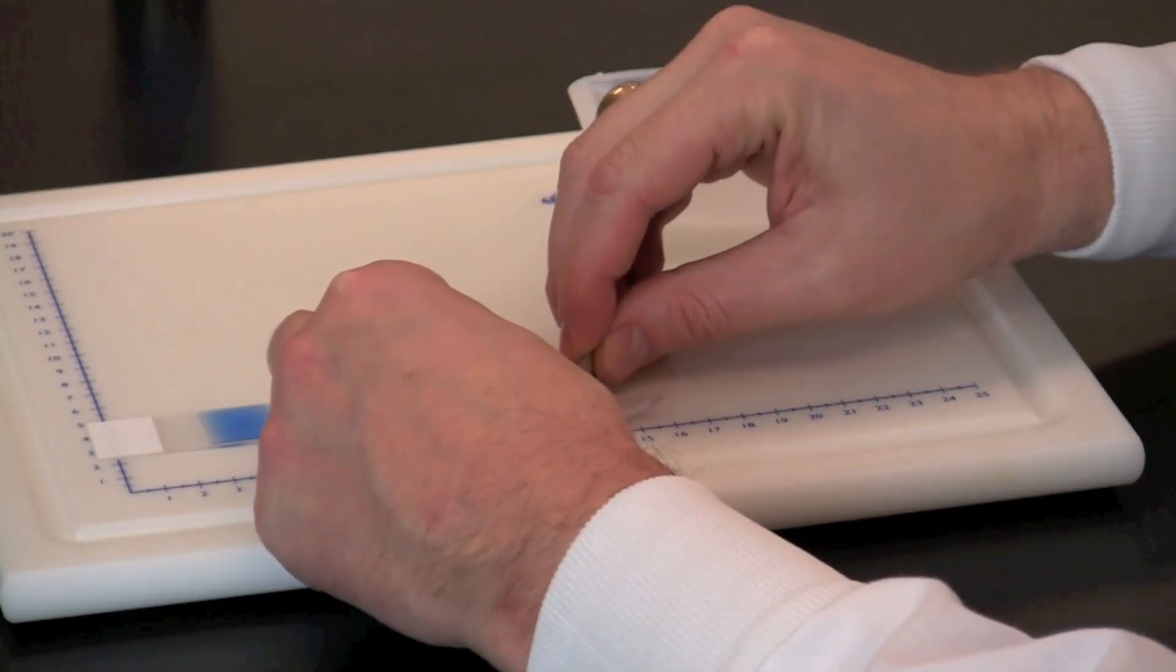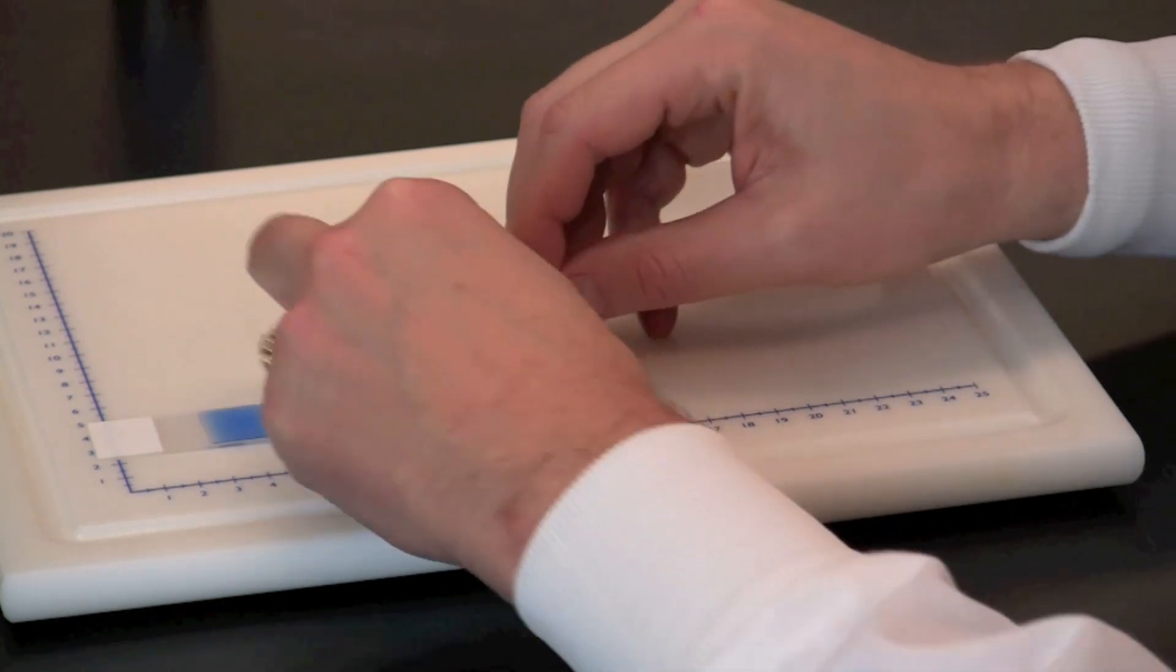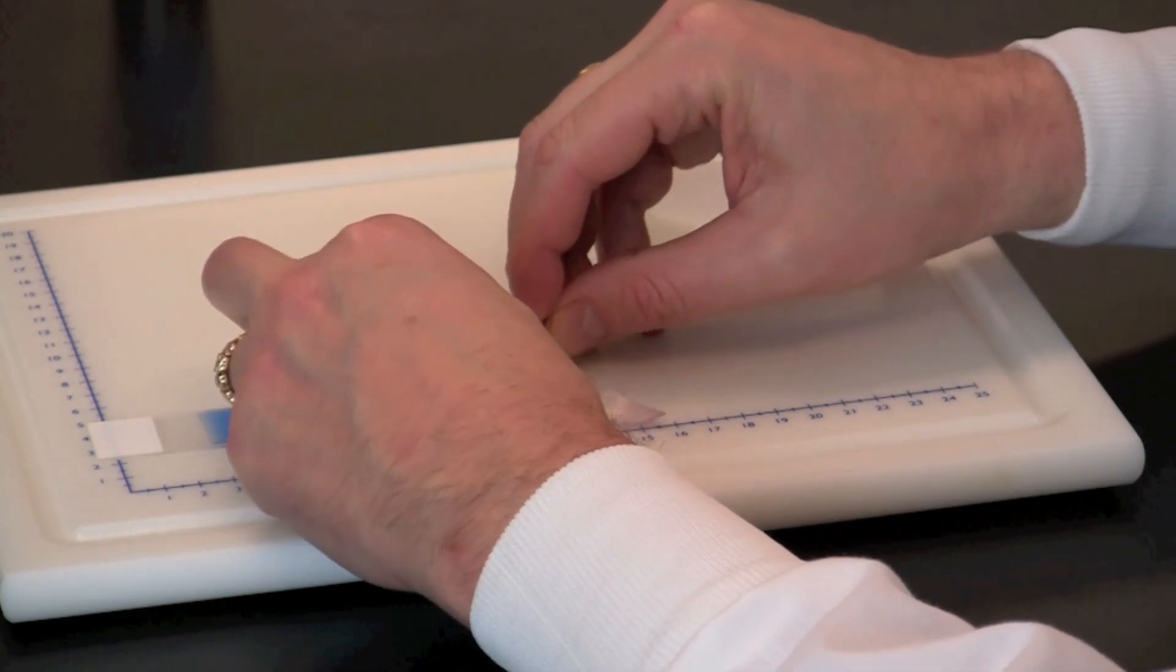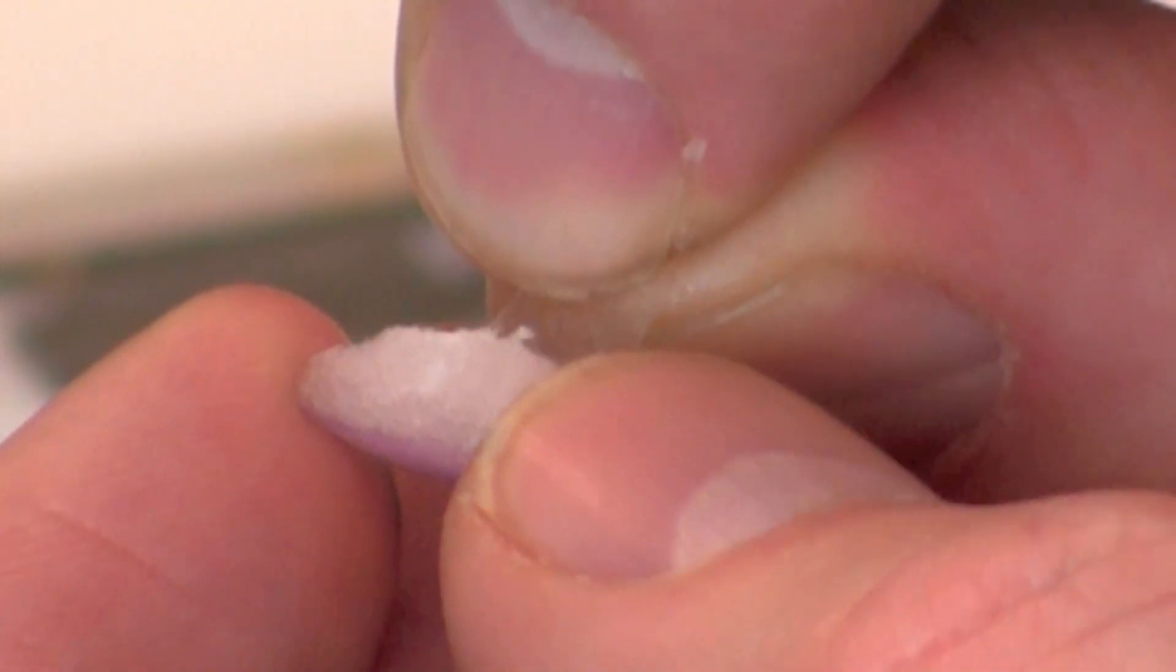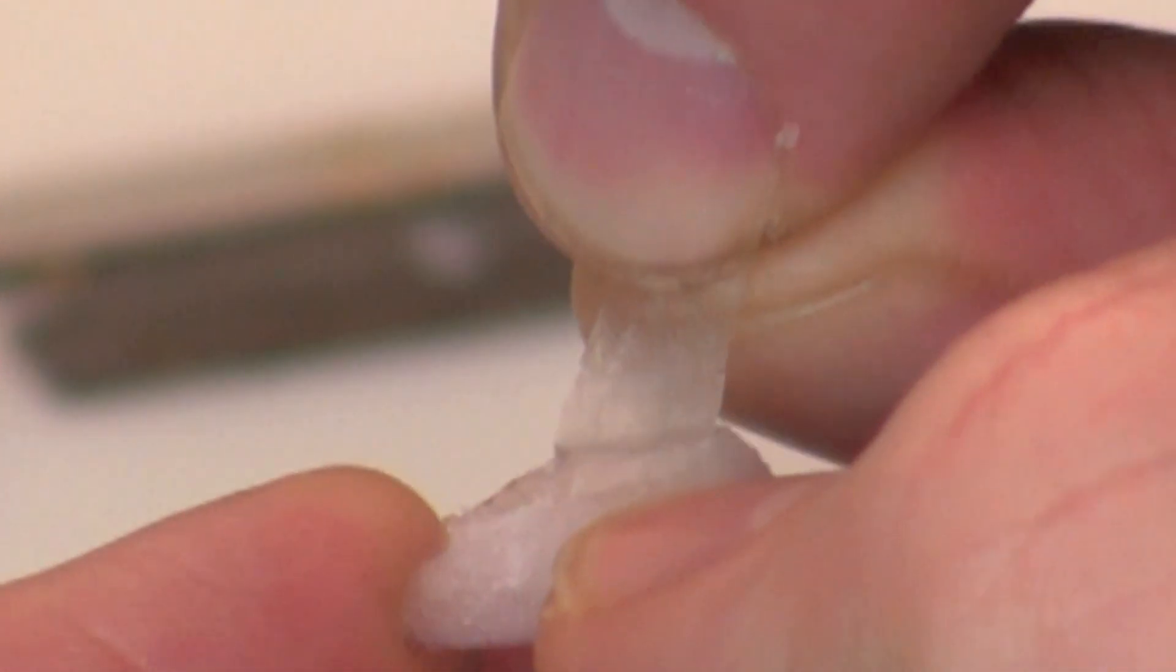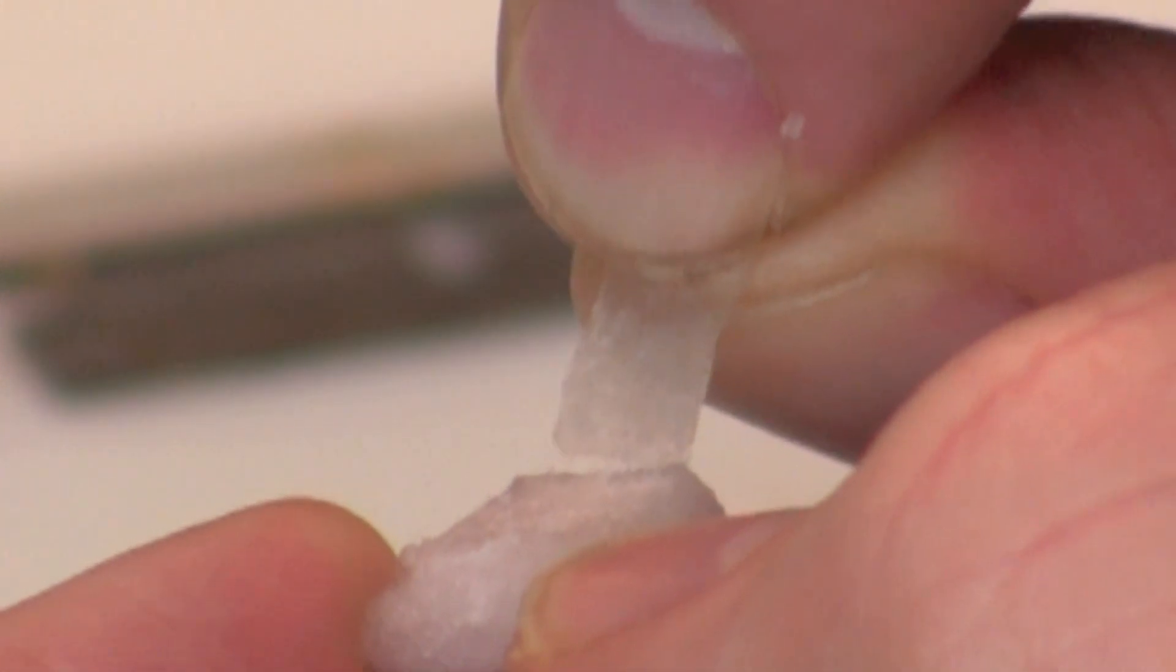Take a small piece of onion. Peel a piece off the inside epidermis of the onion leaf scale that is roughly one half to one centimeter squared.